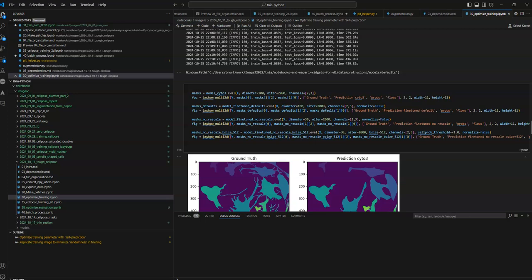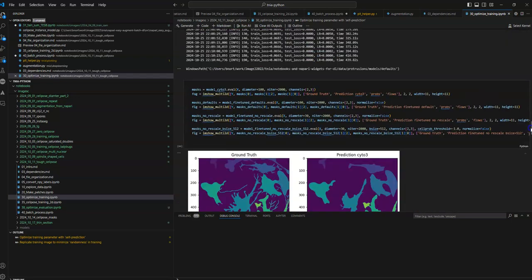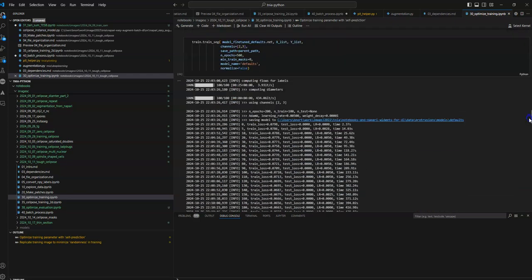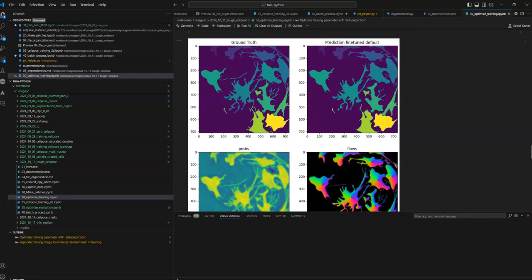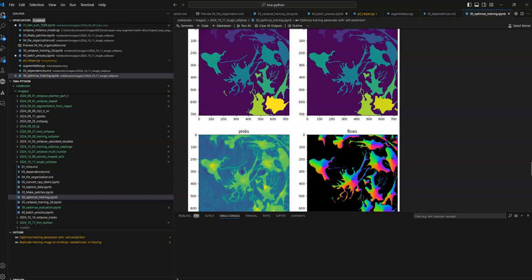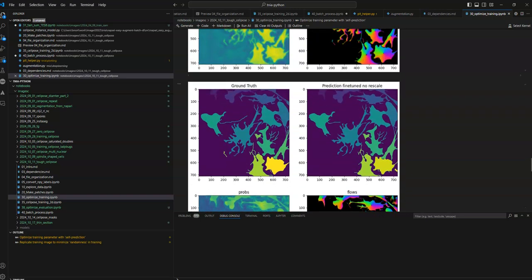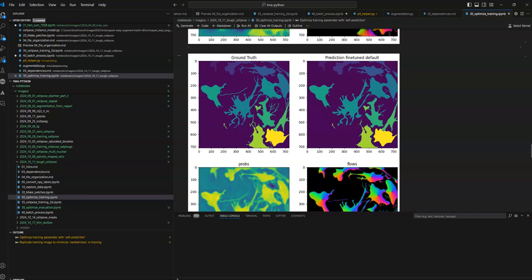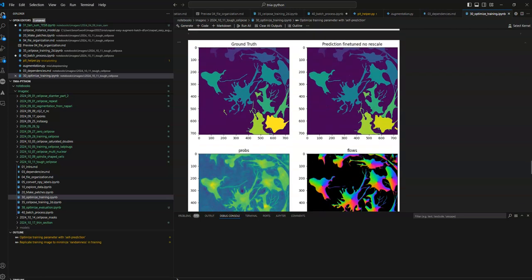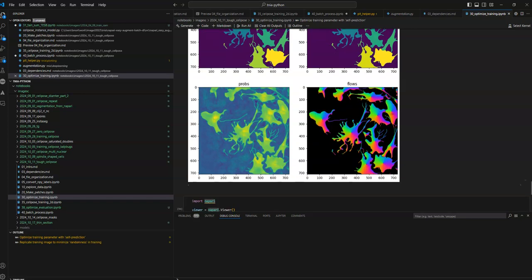I'd love to hear more feedback about this if I'm just hacking and there's a better way to do this. But with that combination of rescale equals false during training and diameter equals 30 during prediction, if you look here, I start to get probabilities that are much sharper, and you're seeing a little more fine structure in the prediction as well. So with the defaults, you're missing some of the protrusions, and then you turn the rescaling off, and you're getting some more additional protrusions.